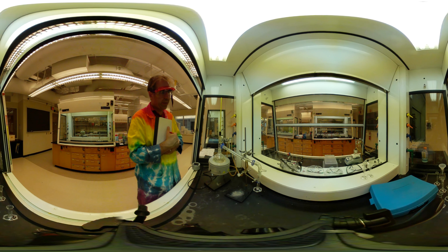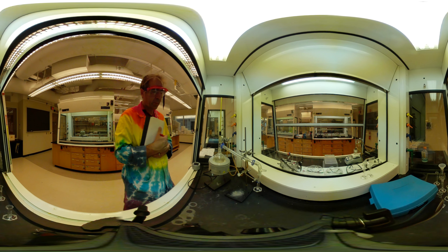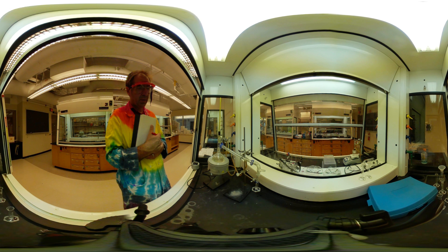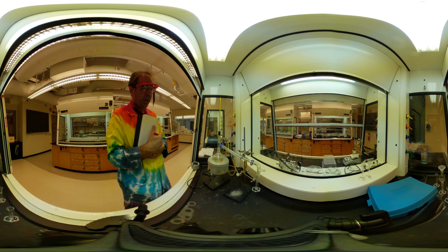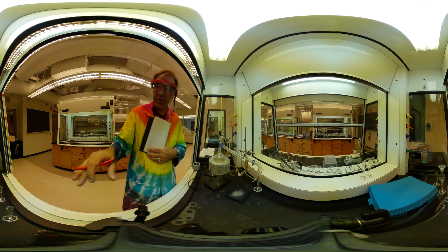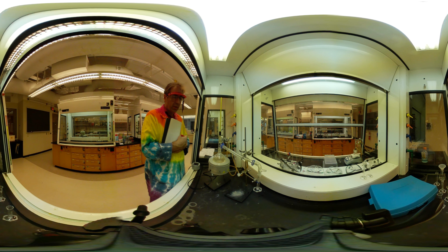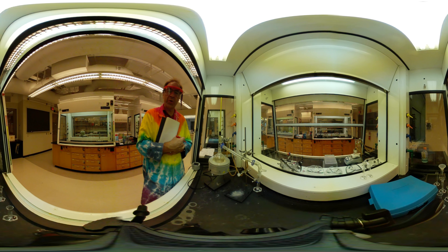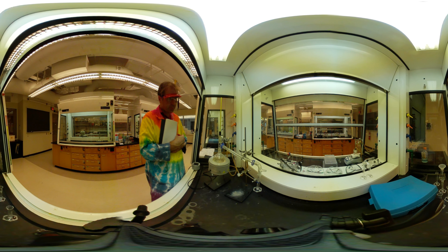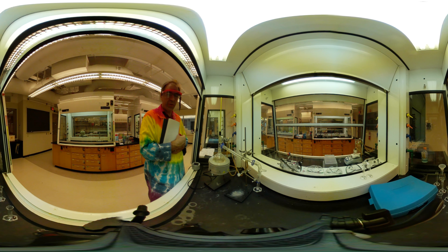At this point I'm going to go ahead and let it start slowing down. My temperature is going up quite a bit. So at the end, once again, we'll take the mass of every one of these graduated cylinders and record their volume. That data will be provided for you for analysis at the end. We just need to clean everything up and make sure it's all nice and dry and clean and ready for the next student.